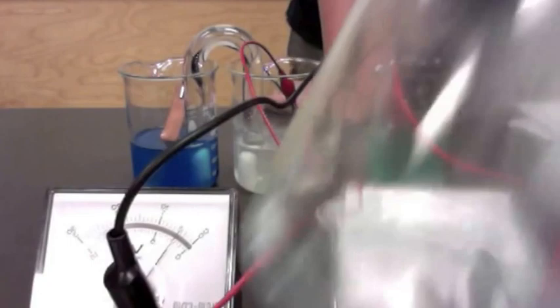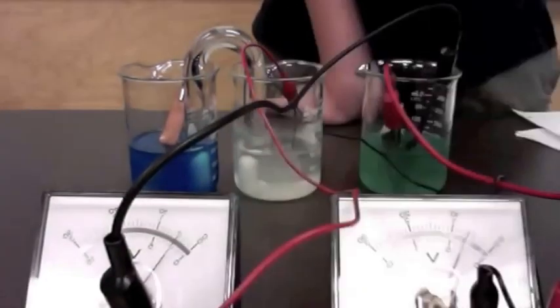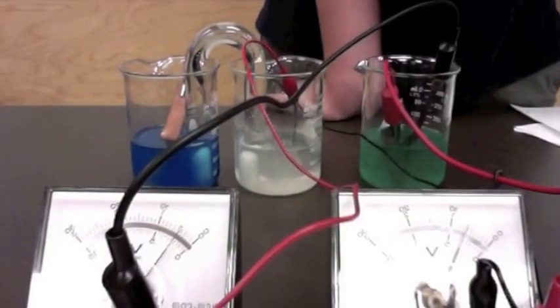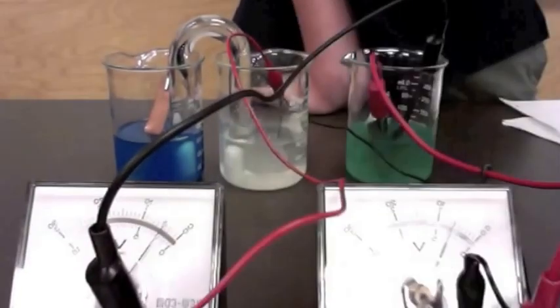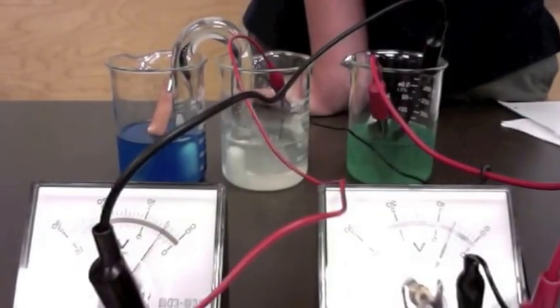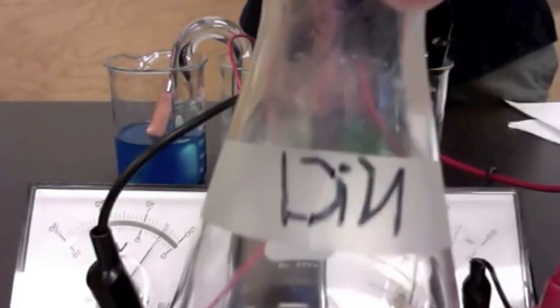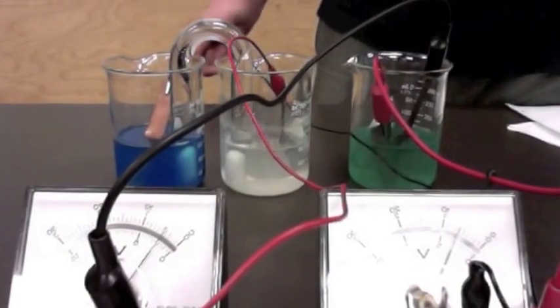So as you can see here, these are the beakers that I used to make the solution. I needed one molar solutions to go by the table, so I calculated the amount of mass I would need of each compound to give me a one molar solution.